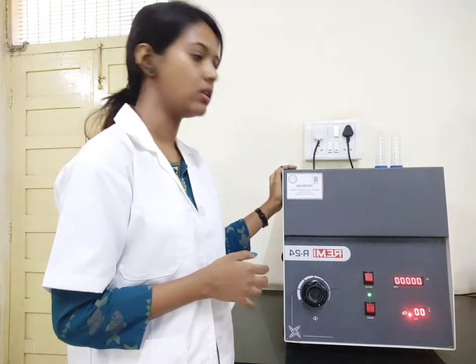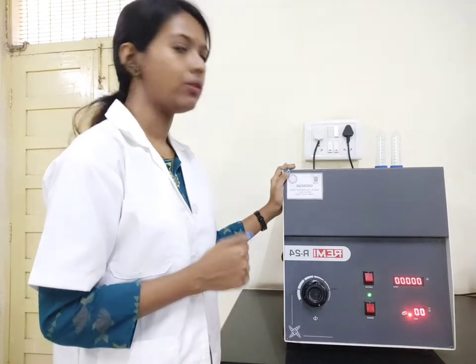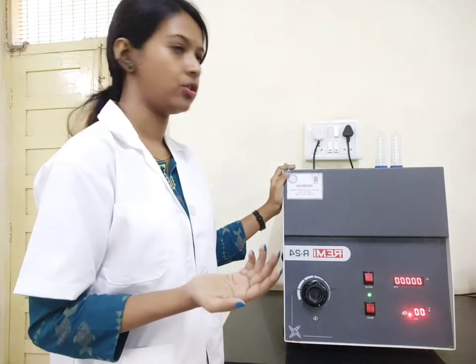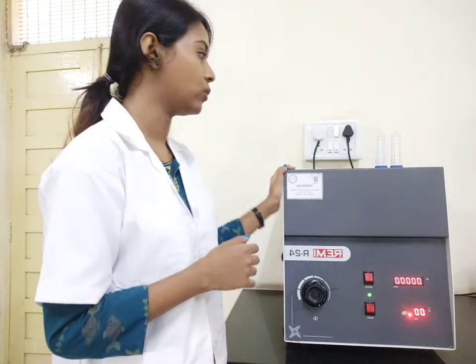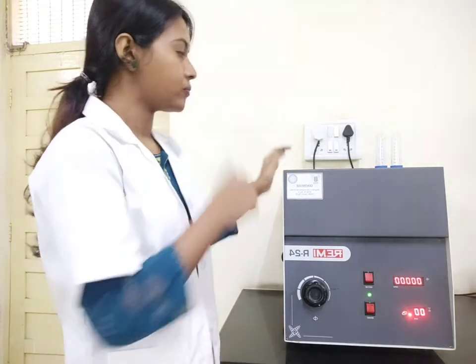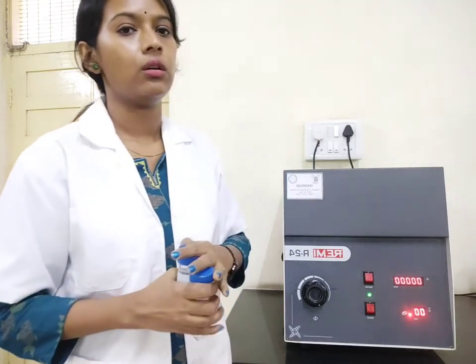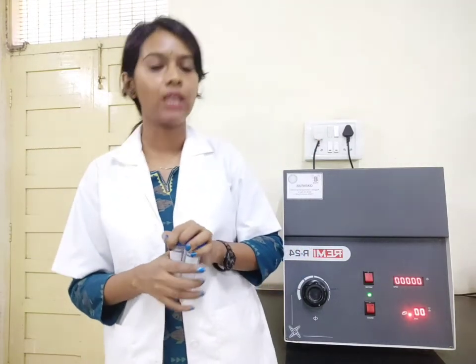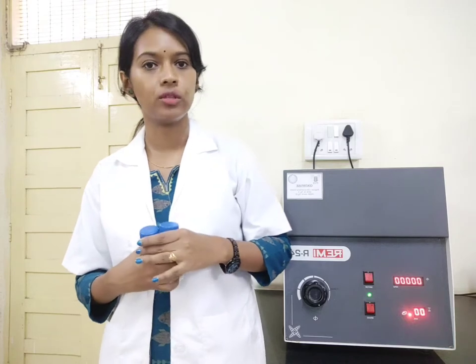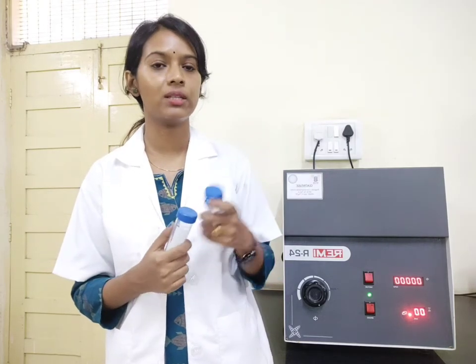Only when the speed is back to 0 are you supposed to open the instrument. Never open an instrument when it is rotating at high speed. One more important thing: whenever you are using a centrifuge, you have to keep the sample in centrifuge tubes. The liquid sample that you want to separate — you have to take the entire extract in this type of tube and then keep it inside the instrument.